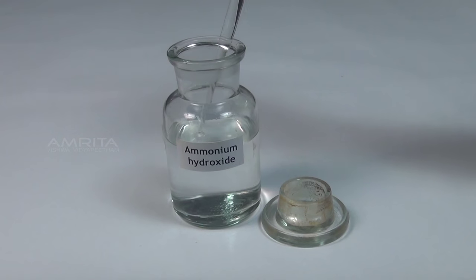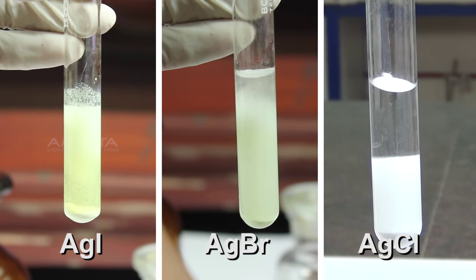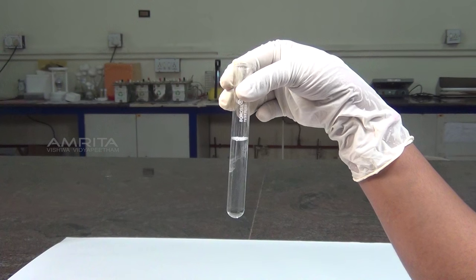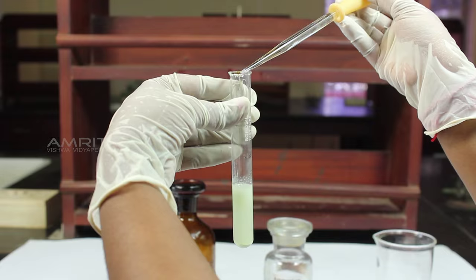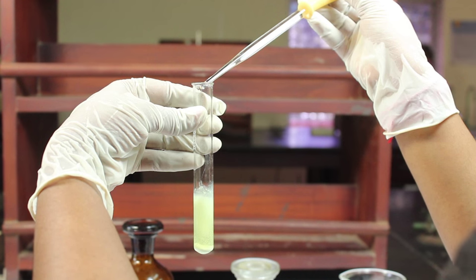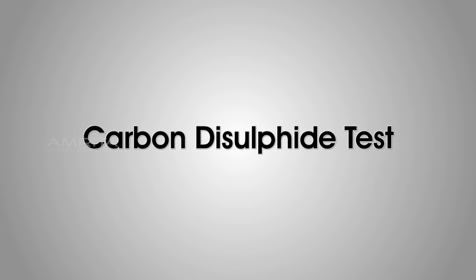Now, using another dropper, add excess ammonium hydroxide to the precipitates. Silver chloride is soluble in ammonium hydroxide. Silver bromide is sparingly soluble in ammonium hydroxide. Silver iodide is insoluble in ammonium hydroxide.